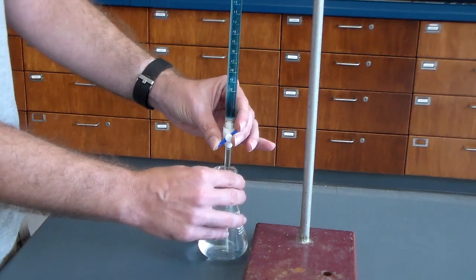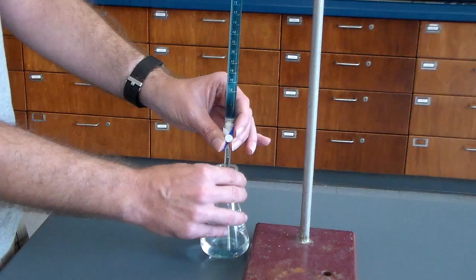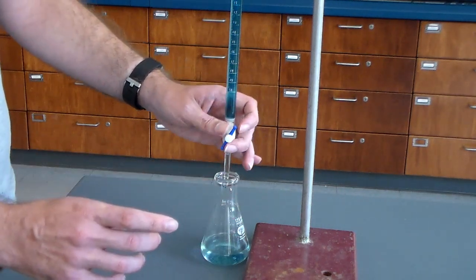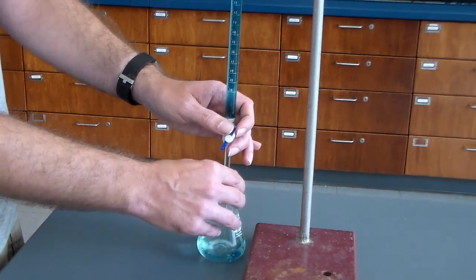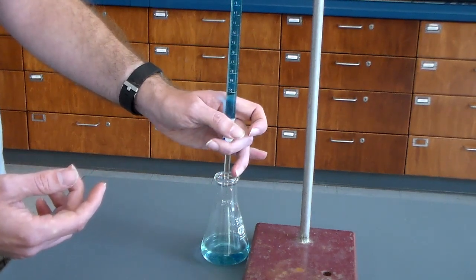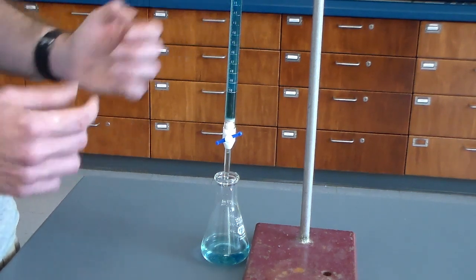And then what you're going to have happen is, your liquid is going to start coming out eventually, and you can simply just control that either if you want, a strong flow where it's coming out very fast, or if you want a weaker flow where you just want a drip at a time. And again, it's very easy just to control this with your left hand. So then at this point, you're basically just swirling around and just watching for whatever color change you're actually looking for during your titration. And then once you get your desired color change and you're all good, make sure that you close the valve to stop any additional stuff coming through, and then you go and read whatever level you're actually at, and then you're basically done.